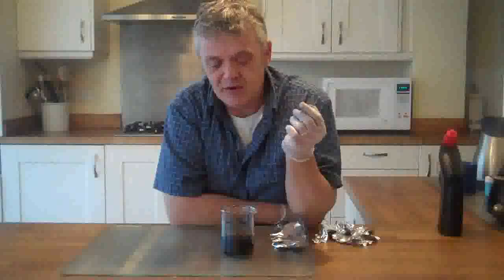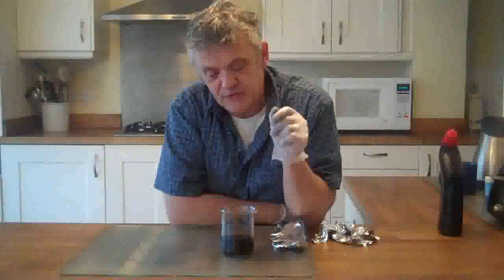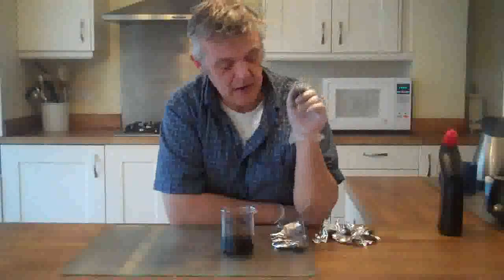I know that because I weighed the dried graphene that we made, and mixed it up to a known volume. I made a 10 milligram per milliliter, a 4 milligram per milliliter, and I took some 4 milligram per milliliter and diluted it up to 100 mils. So, we've got a 1 milligram per milliliter GO solution in there.